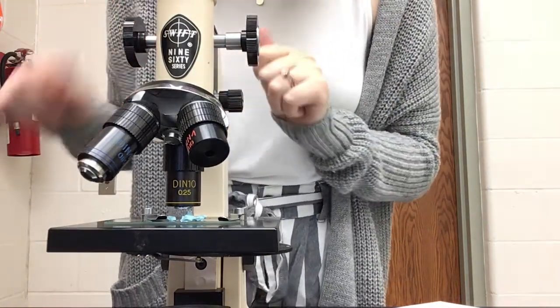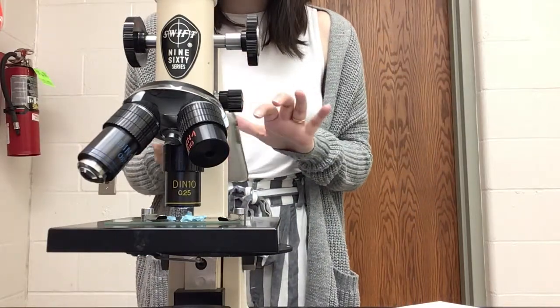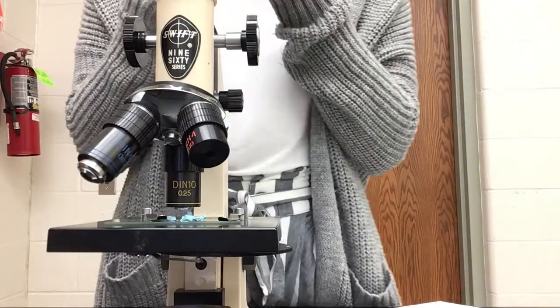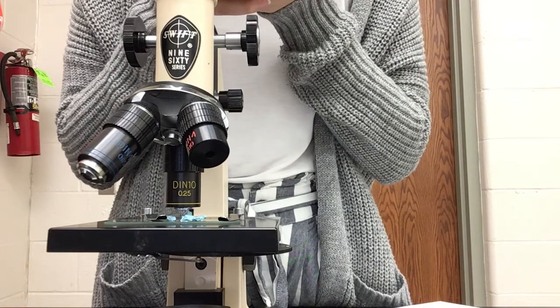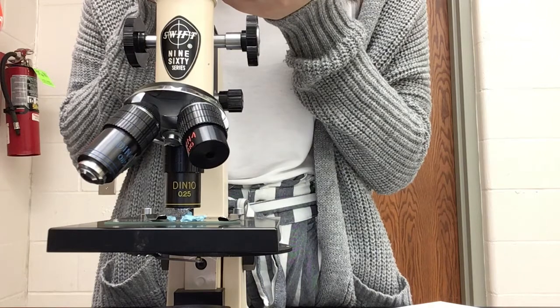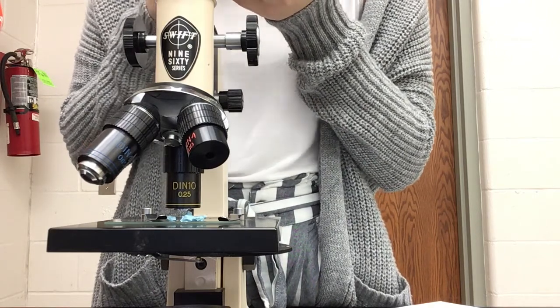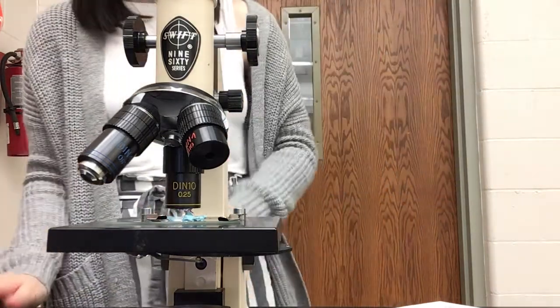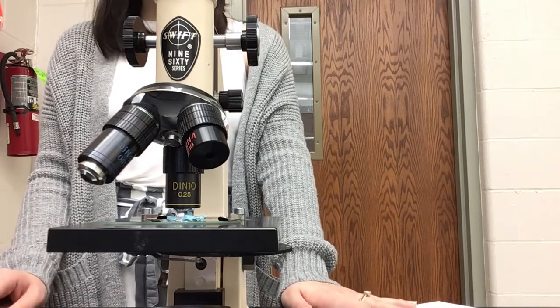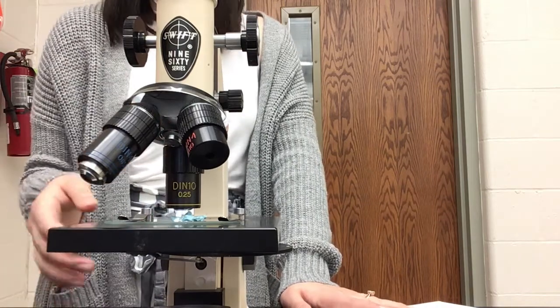Now it's hard to tell, but I will attach the photo, and I will attach a better photo of copper so that you can see up close and personal. Taking it with my phone. See if I can get a photo. Okay, it is very difficult to get a photo, so I will see if I can get photos with the other ones, but if I cannot, I will show you what it should look like in a photo I get on Google.